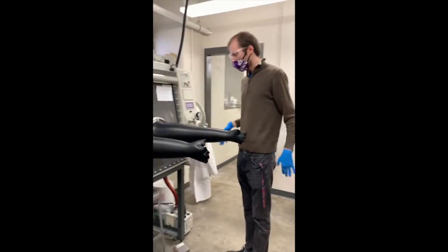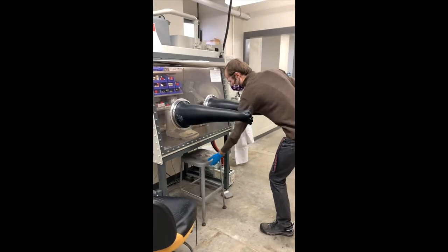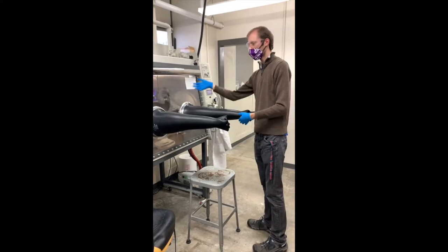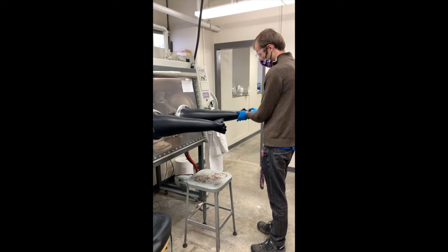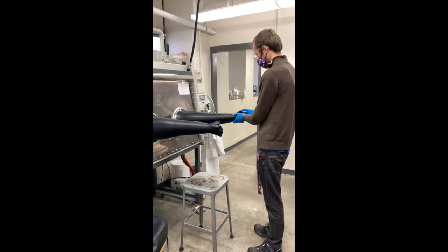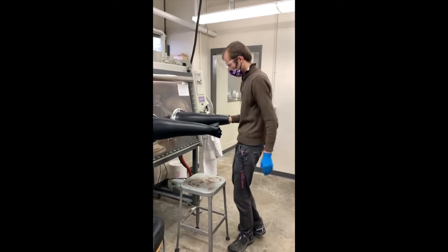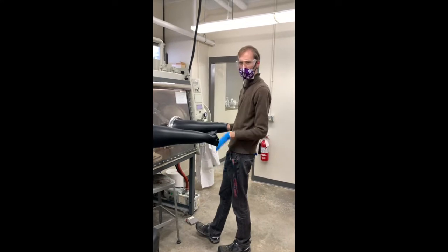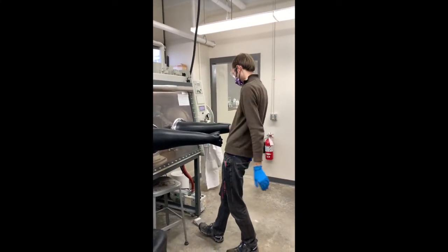So next we're ready to enter the box. We'll turn the light on, pull the stool out. And as I push my arm in, it's going to increase the pressure in the box. So I'll just get my hand in here, but I won't go in yet.